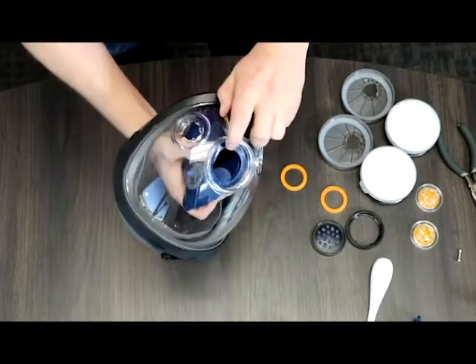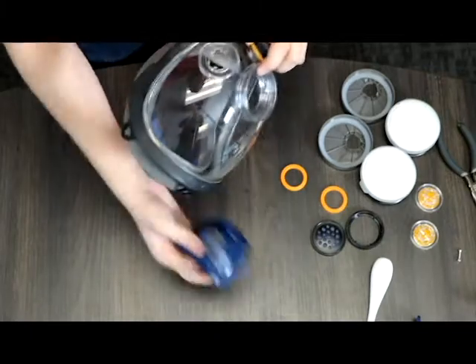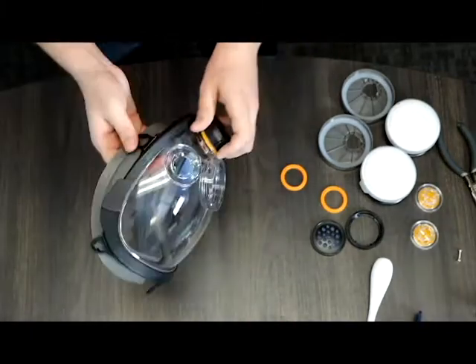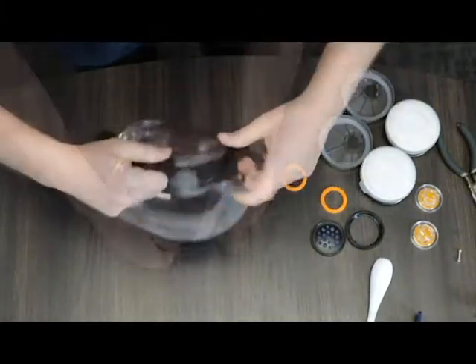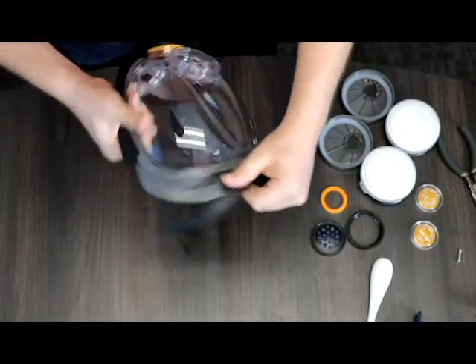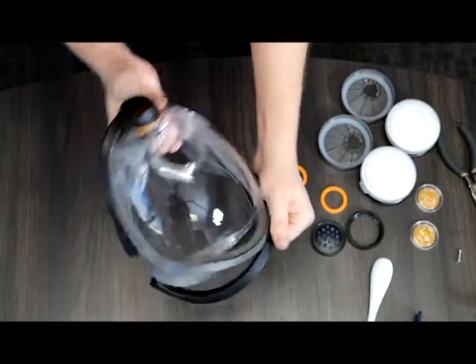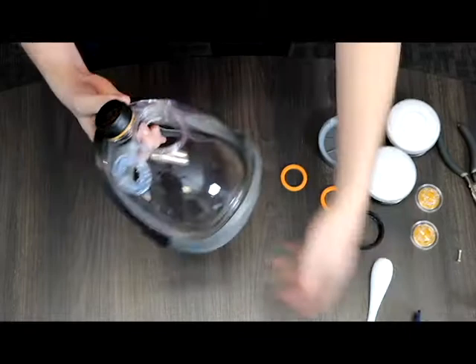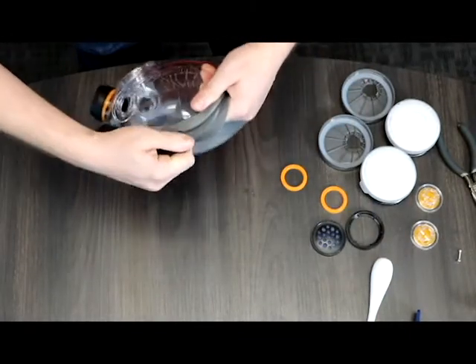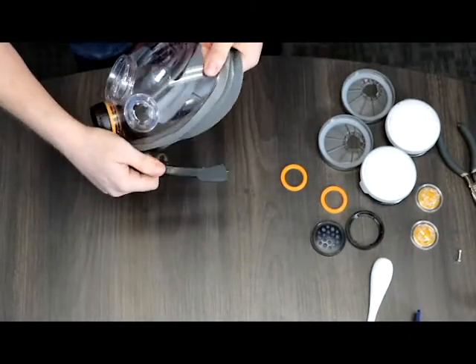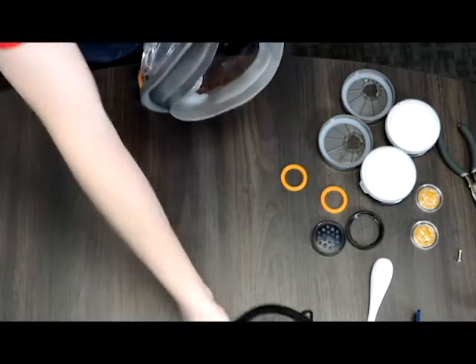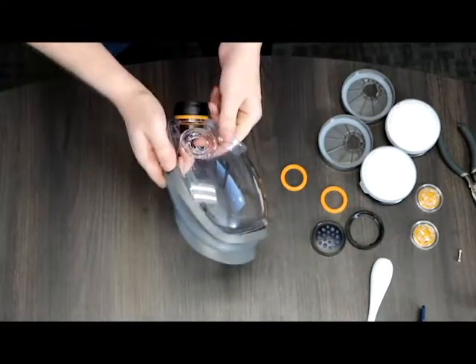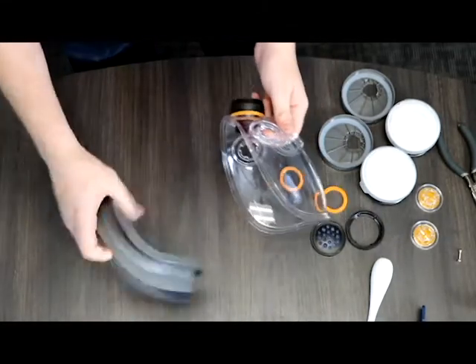And then we're going to pop out the mouth and nasal cup there. And finally we remove the black frame. You got to pull it off a little bit as you can tell, then the seal kind of pops off. And once you pull this off you will be done. You will have successfully taken apart the PD100 or PD101 face mask.